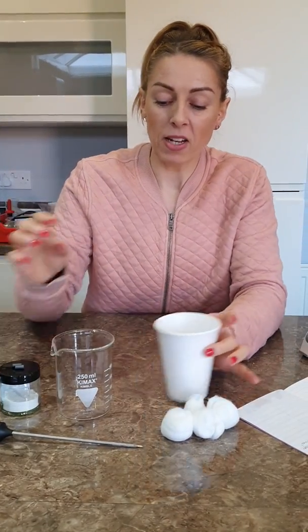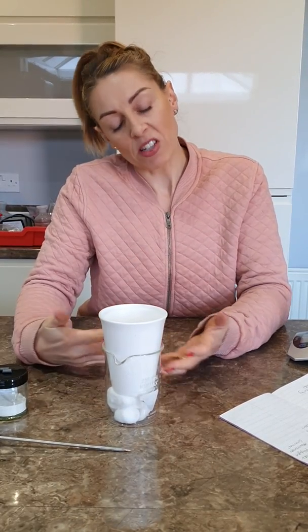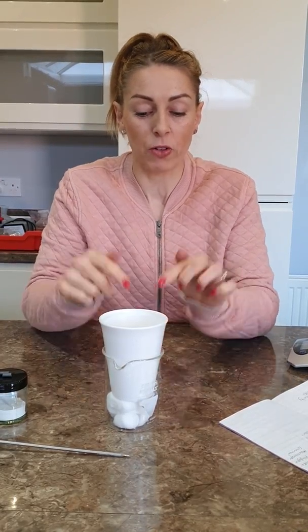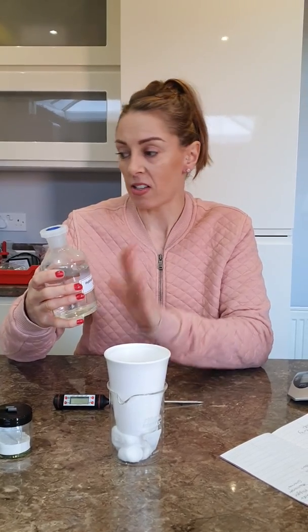First, I'm going to put some cotton wool into my beaker and place the polystyrene cup inside. This is an exothermic reaction, which means heat energy is transferred from the chemicals to the surroundings. I want to measure that temperature change, so I'm trying to insulate the practical as much as possible — the polystyrene cup acts as an insulator and the cotton wool prevents heat transfer.